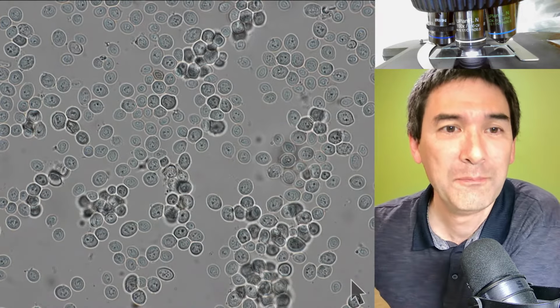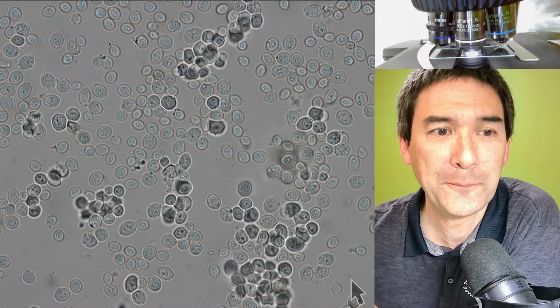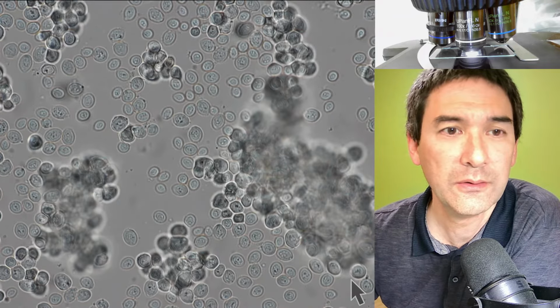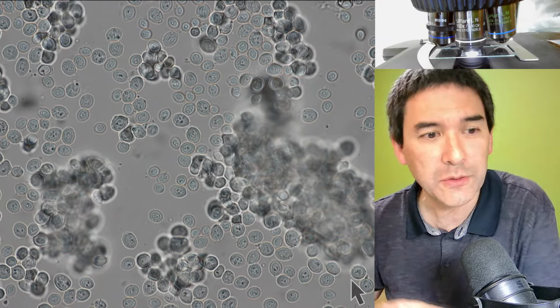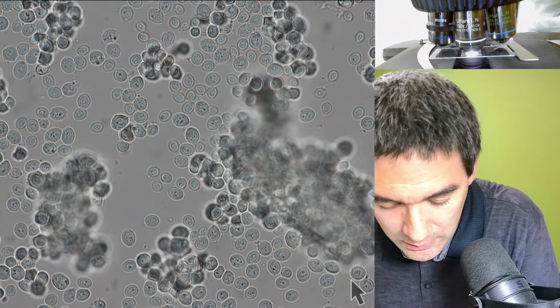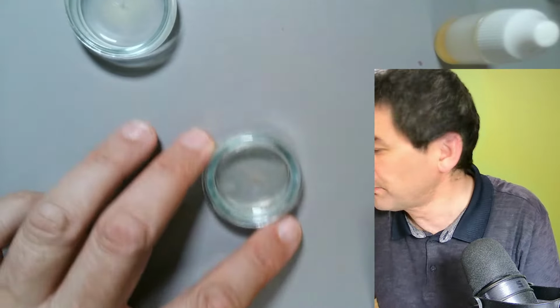Okay. So this is basically, again, a short demonstration of how the yeast cells look in bright field. And you know what? Last but not least, let's try, I forgot which one I just took. Maybe these here, I don't know. Let's have a look at some of those bacteria as well.